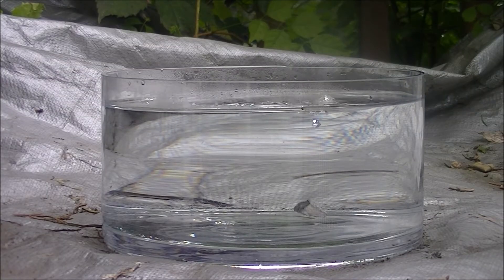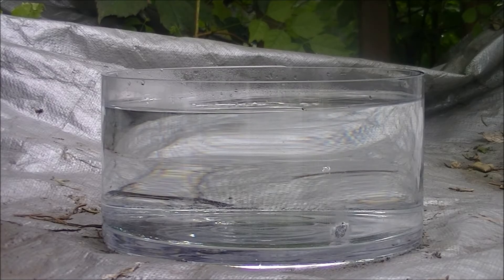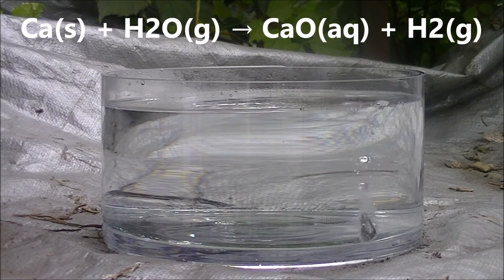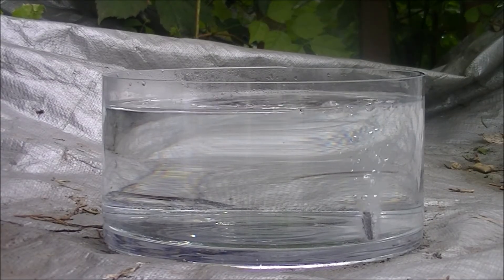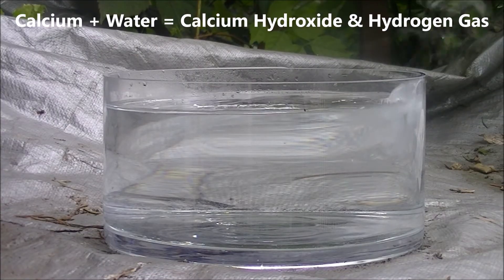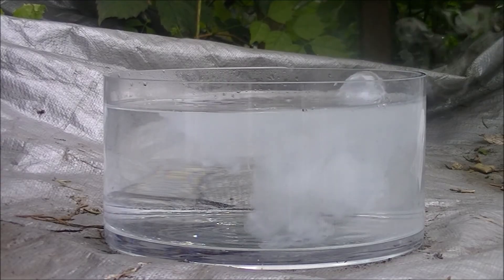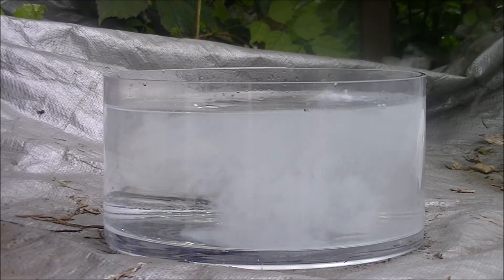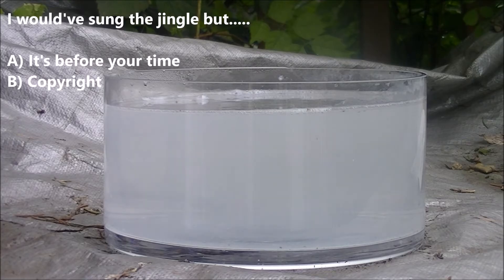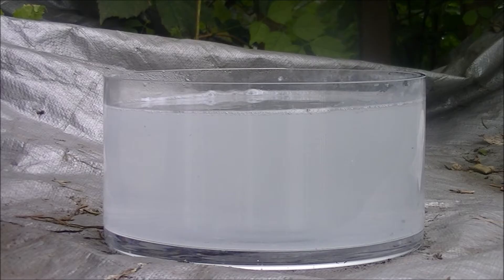Here's calcium. Calcium is a lot more fun to use — it kind of reminds me of an Alka-Seltzer tablet. But we're not done yet; we've still got two more to go.